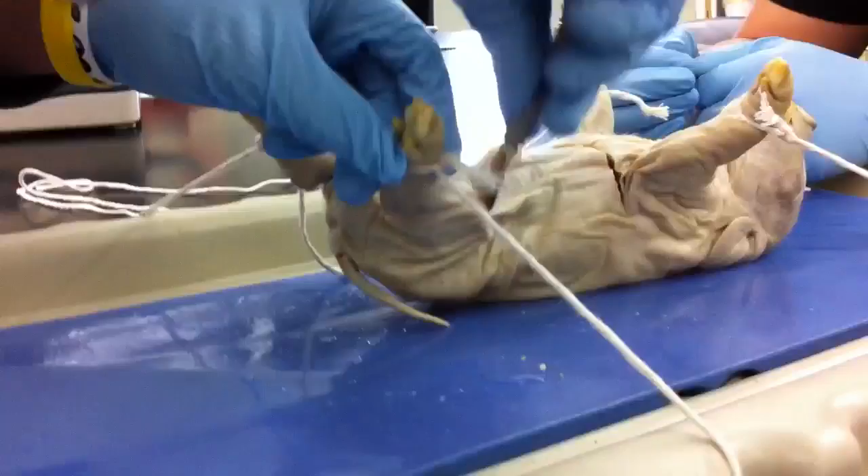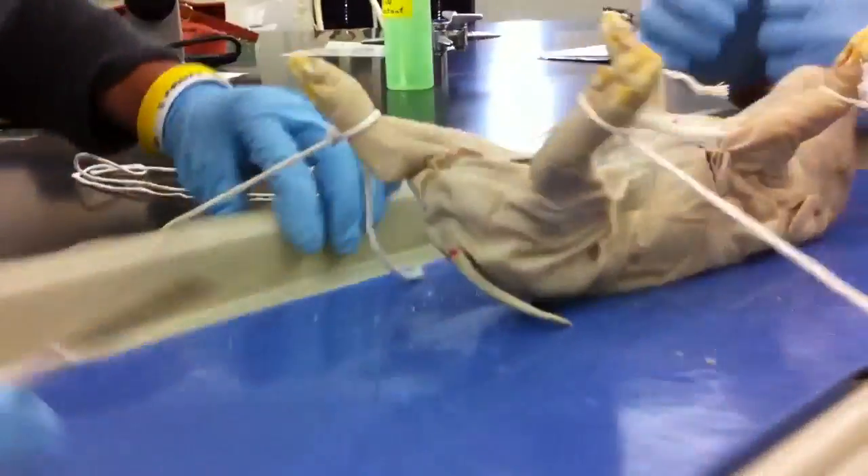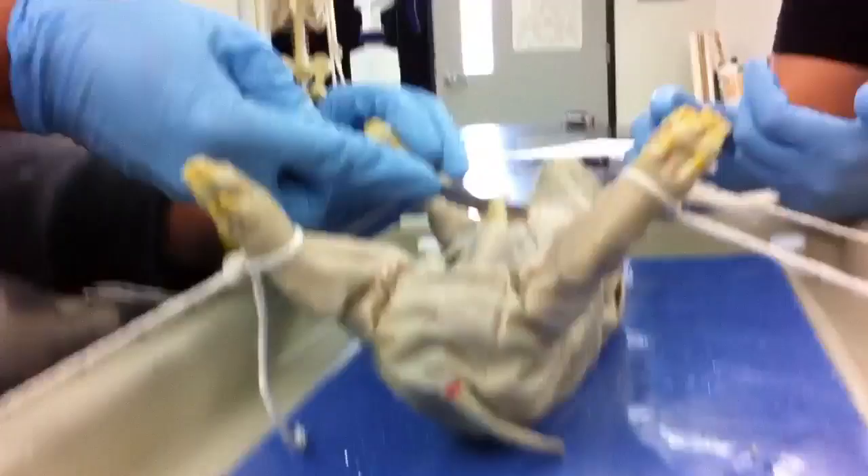That's Dave. He looks like me, man. That don't look like me. It's not going to hurt you if you touch the pig, man.